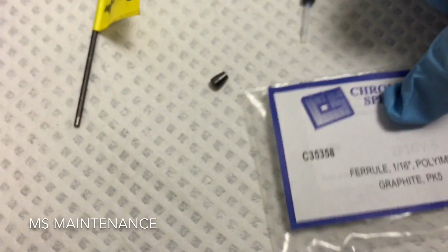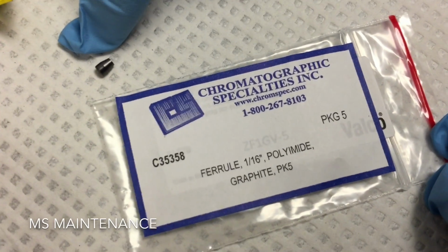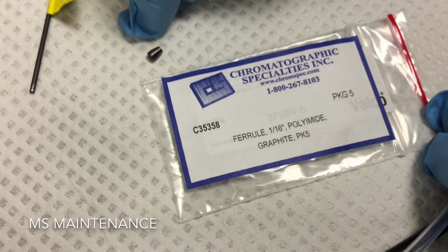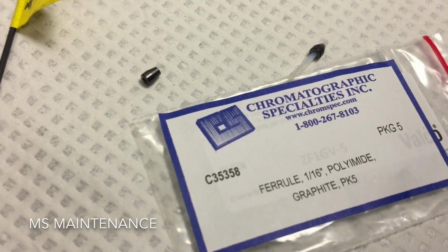So over here we have an example of a graphite ferrule, and of course it's made of graphite, but it's made to be the same inner diameter as the outer diameter of this PTFE tubing.